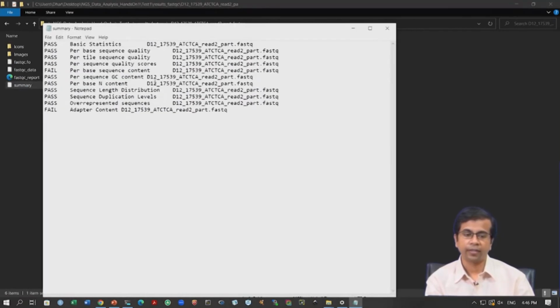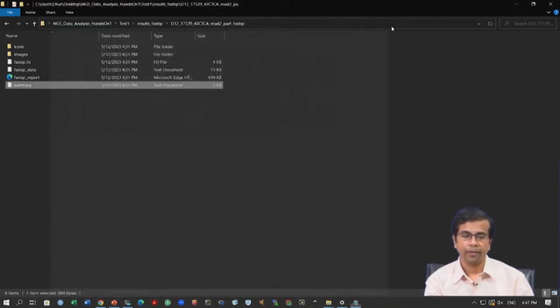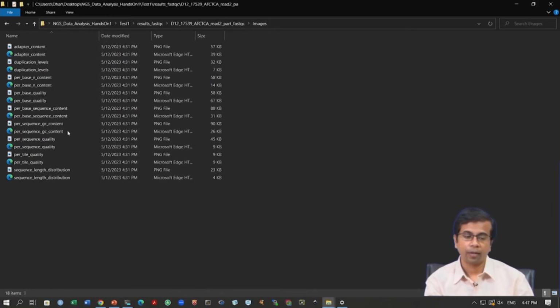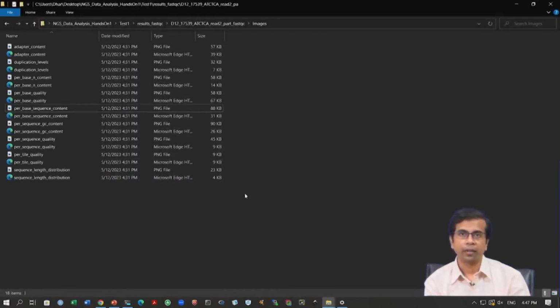We will again have a very similar summary file, and again you see two points where you see this fail. Okay. So, you have per base sequence content and then you have the adapter content. Okay. And without blindly believing the statistics, we can actually go and look into the images. So, per base sequence content, we again see a very similar thing, right. In the beginning you have these fluctuations and that is expected in case of Illumina, but for the rest of them it is quite normal, and this is an AT biased genome. So, it looks okay. So, we are not too worried about this warning here.